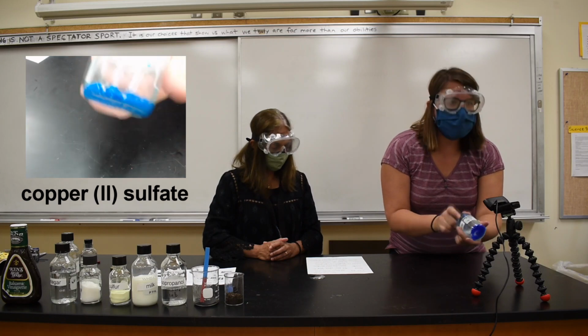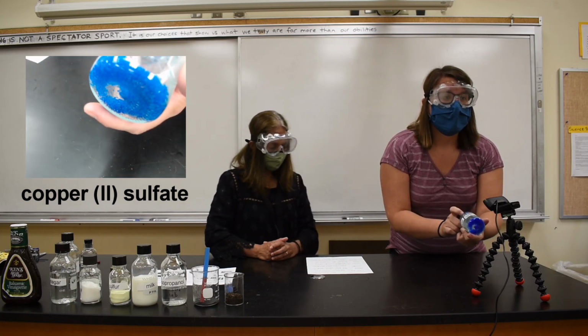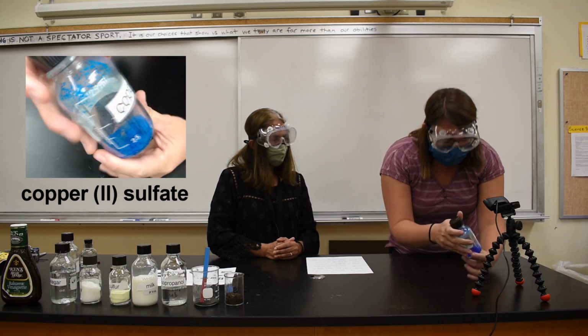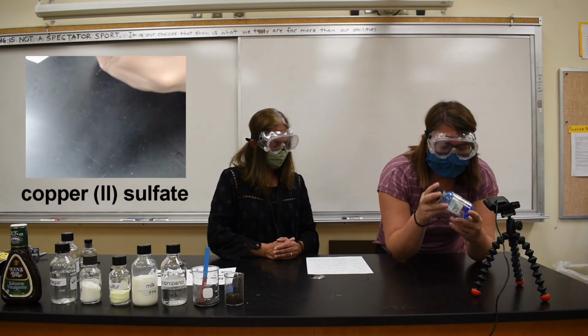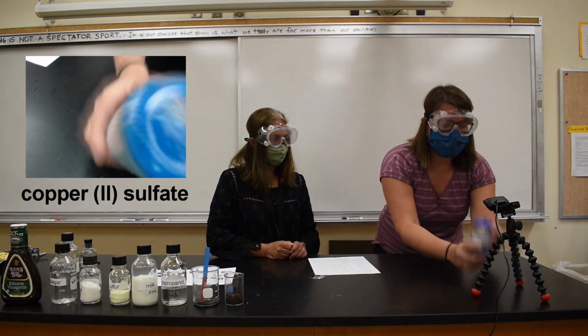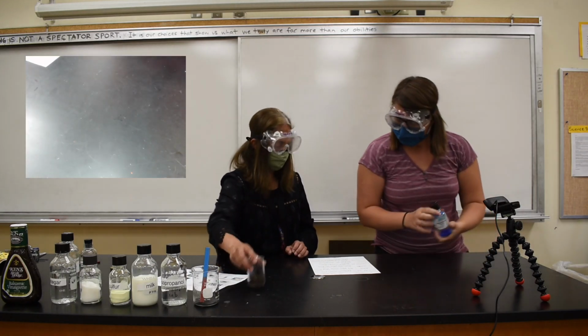Now here we have something else, and this is called copper sulfate. It's very different colored, right? It's bright blue. It looks kind of powdery. Yeah, or maybe it used to be powdery. There's big crystals in there, but it also looks kind of gooey or sticky, like it's stuck to the bottom. See, it's not falling down. So, yeah, copper sulfate.